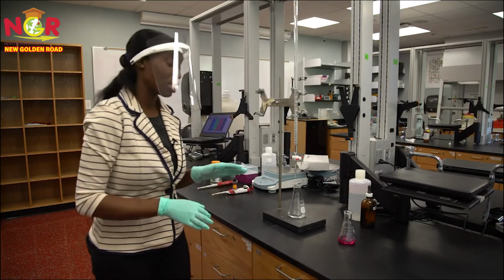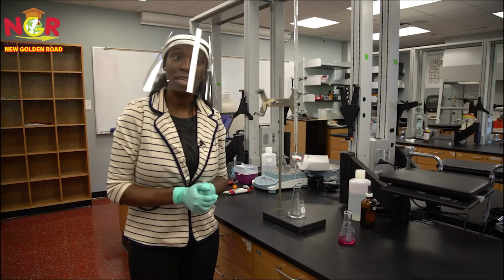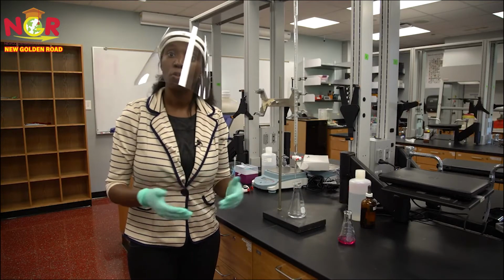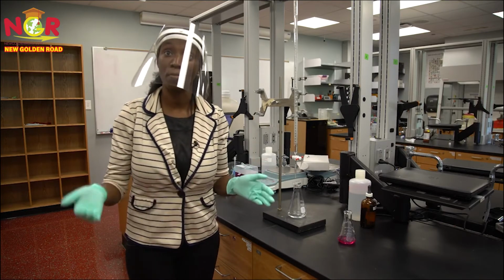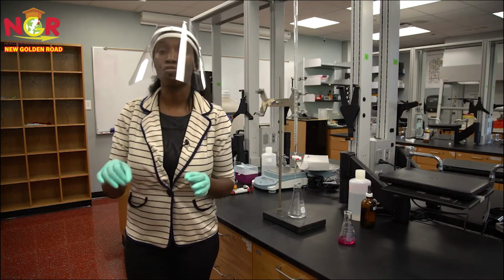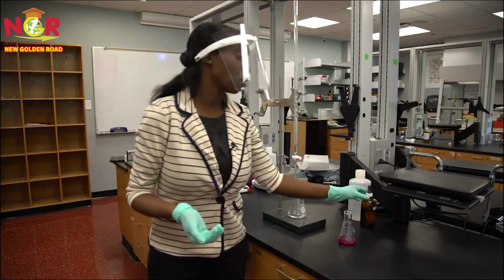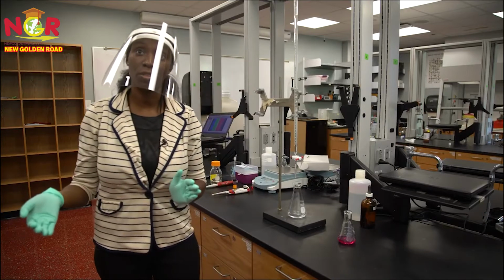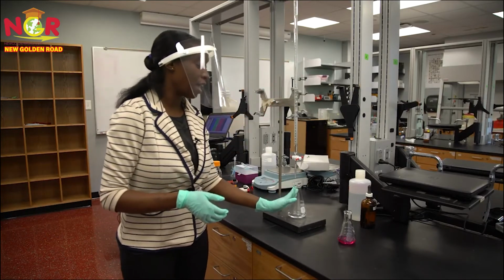So the goal of this experiment is to start out with my acid and then add enough base until I get to the equivalence point, which is simply the point where you have an equal amount of acid and base. After that, any drop that I add will make the solution basic, and I expect my phenolphthalein to change color in the basic solution. This setup is made up of a burette and an Erlenmeyer flask.